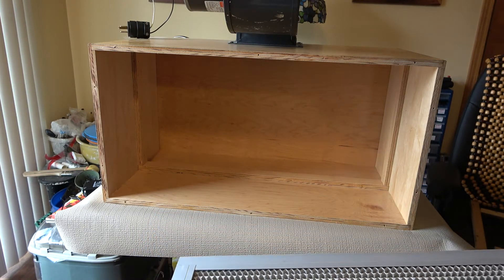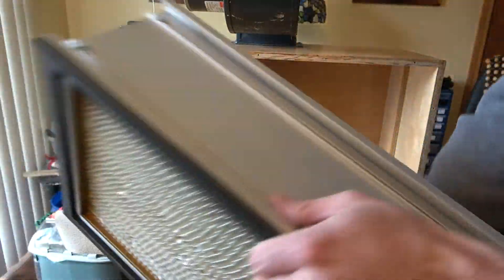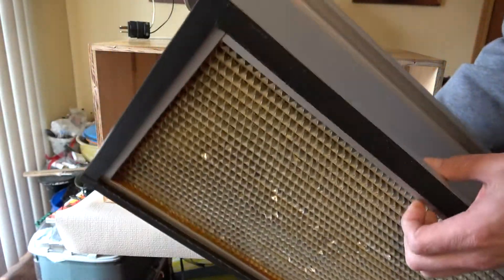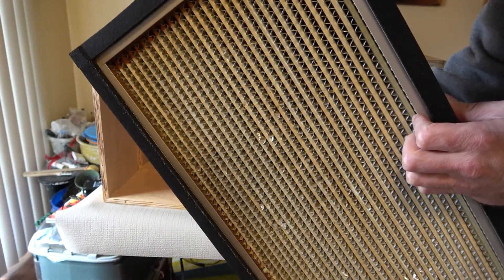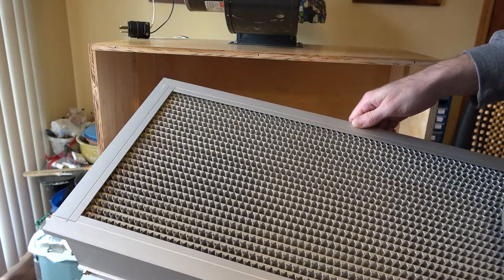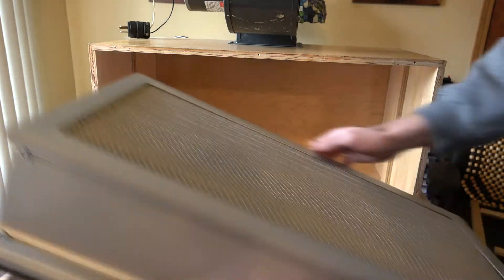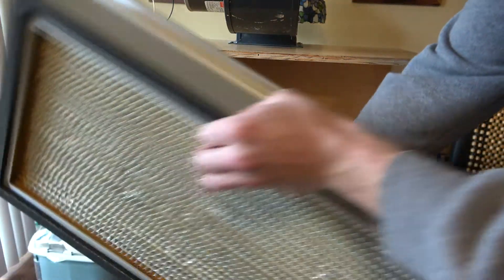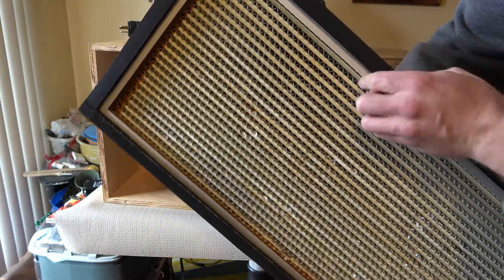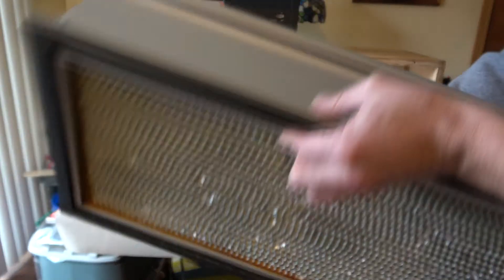All I see is a little bit of sawdust. You can see the back of the filter — it looks in good shape. So this filter probably has some good use to it left. I'll save it, keep it around. Maybe I can turn it into another positive pressure system, kind of like the 12 by 12 unit I have in my lab as positive pressure for the space. I'll figure out something good to do with this — it won't go to waste.